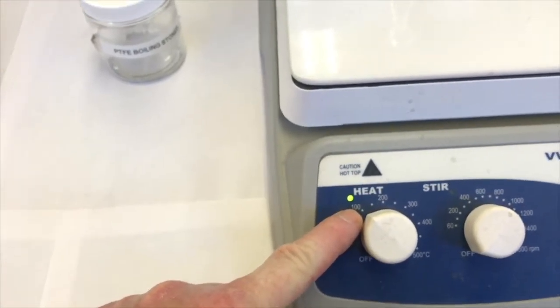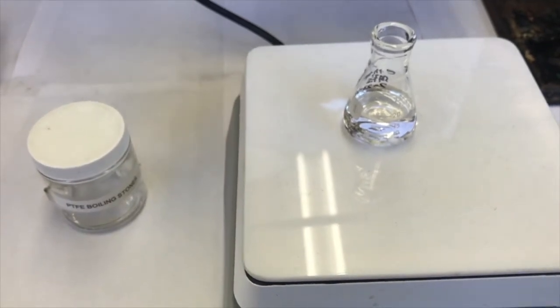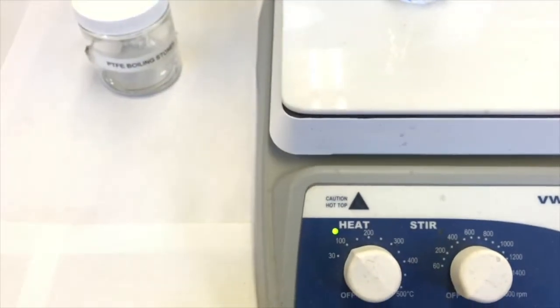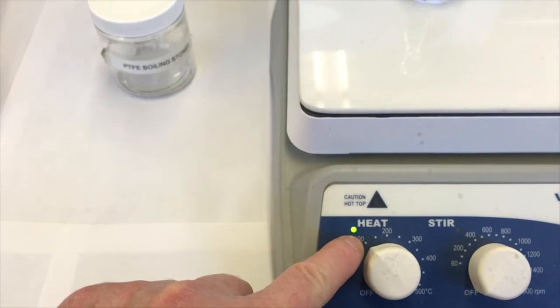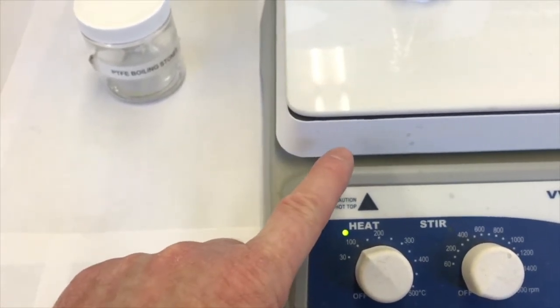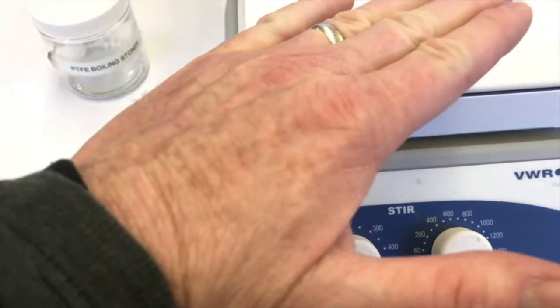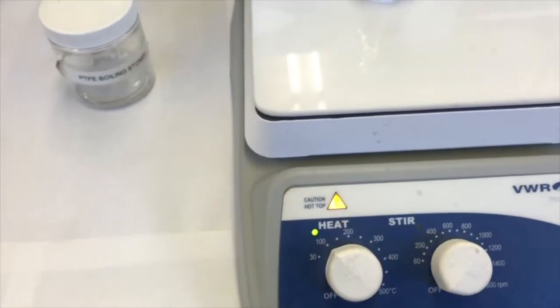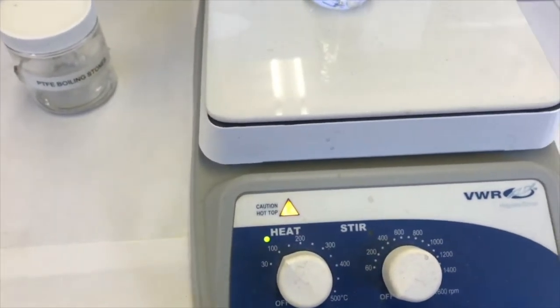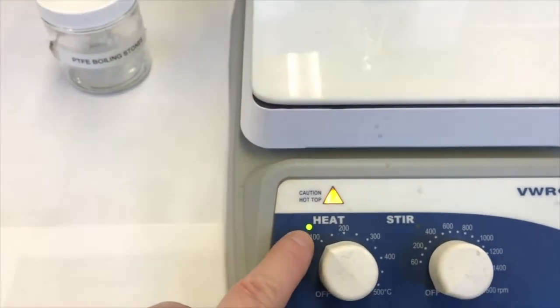So what it's saying is the hot plate is not at 100 degrees Celsius currently, and it's heating to that point. Once it gets to 100, probably a little over 100, I bet once it's heated to about 102 degrees Celsius, it'll stop heating because it's already past where it wants to be, and it'll let the hot plate just cool in the air. Then when the hot plate has cooled a little below 100, probably 98, 99, it turns back on and you see the green light turn on.